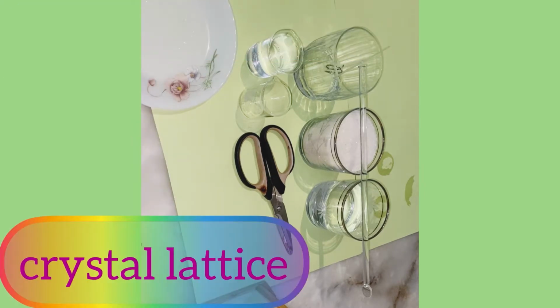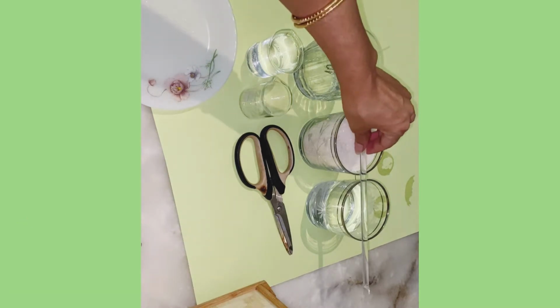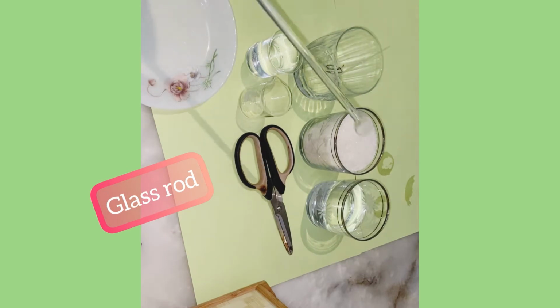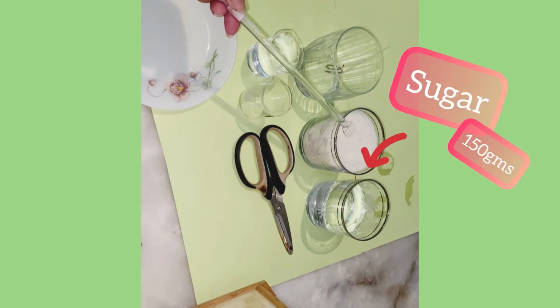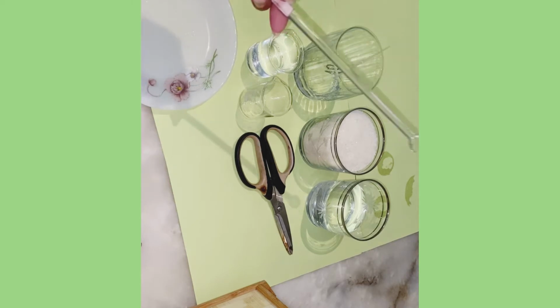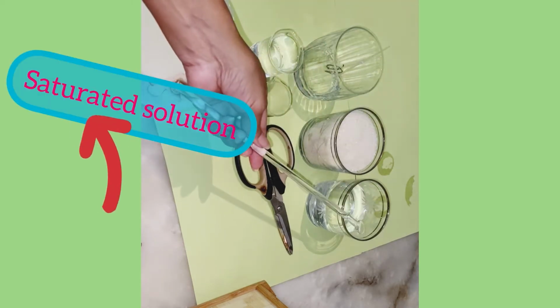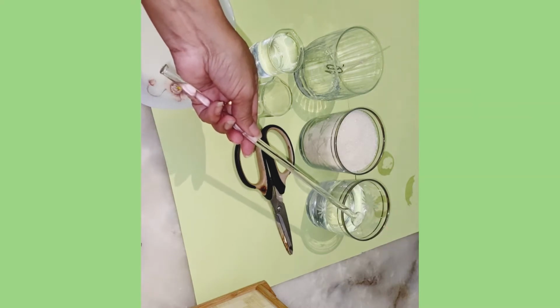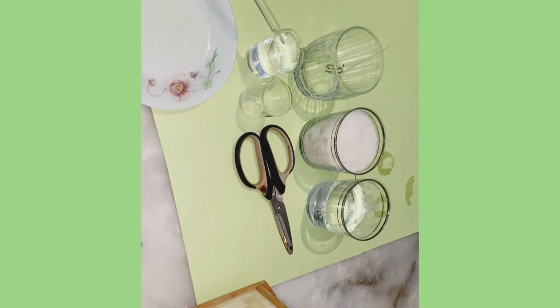So let's start. The things we are going to need are a glass rod, which is for stirring, and sugar, about 150 to 200 grams. I will use it according to my need, because I'm going to make a saturated solution, and I'll need almost 50 to 80 ml of water. I have measured these and already poured them into this beaker.